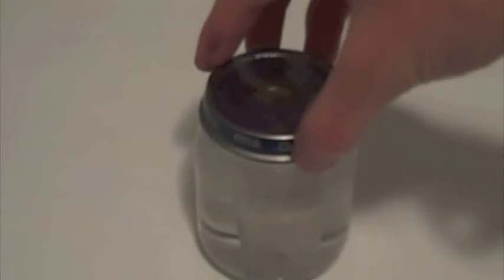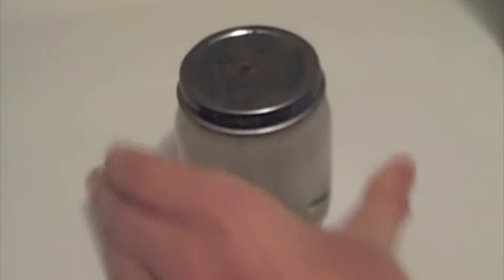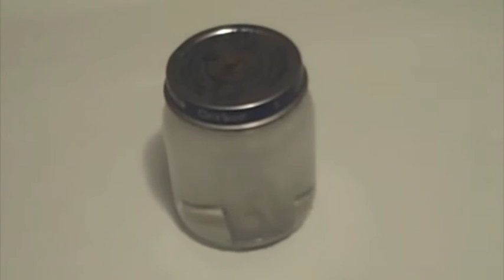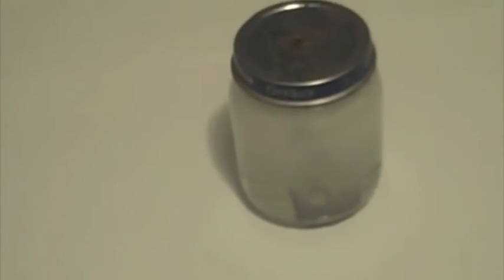Bloopers. Here I'm trying to make the hydrogen torch, so I sealed it with a lid with a hole. The hole is where the hydrogen comes out, which can be ignited. My ignition source are just ordinary matches.